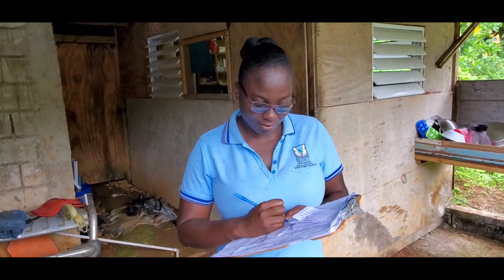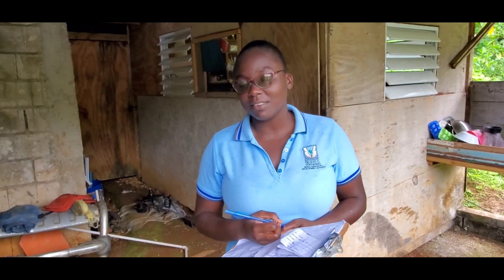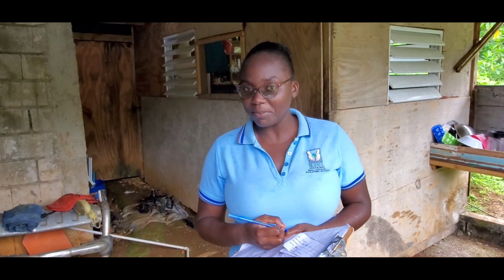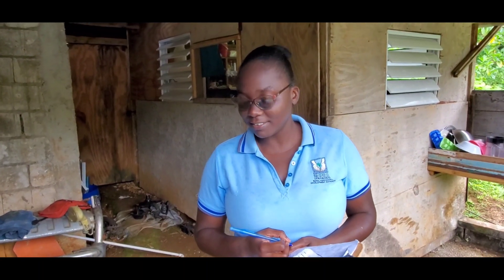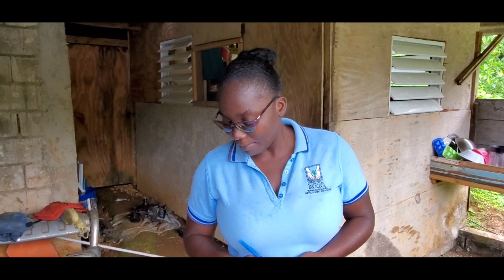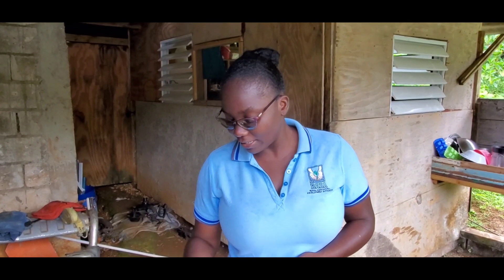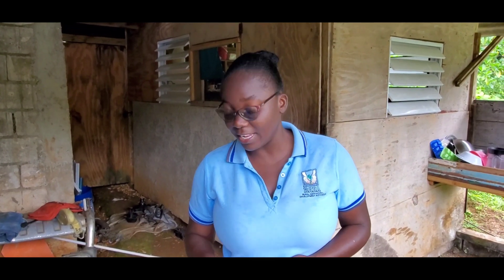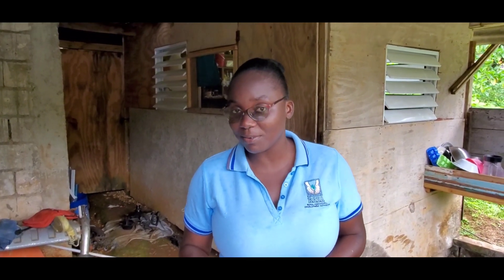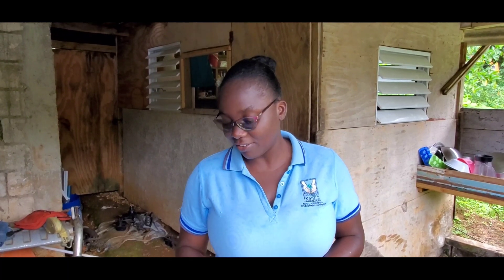Miss Watson explains what she's doing today: collecting forage samples for analysis. Right now she is calculating the initial weight so they can get the dry weight, or dry matter, of these forages.